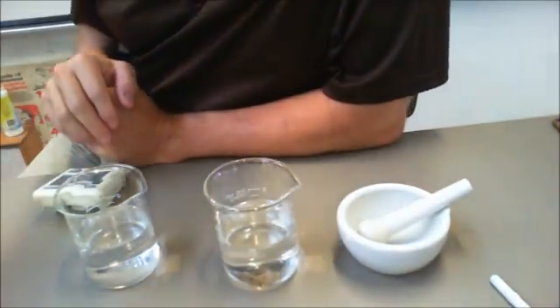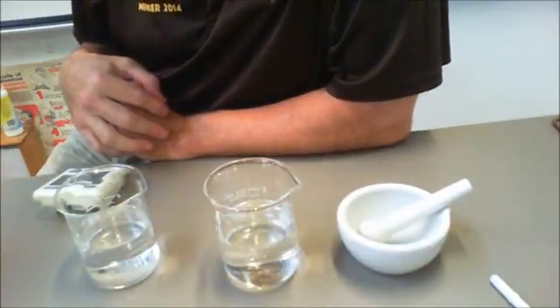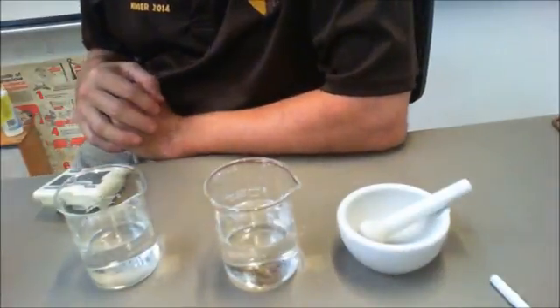Welcome ladies and gentlemen to our third experiment in looking at different effects on reaction rates. And today we're looking at the effect of surface area.